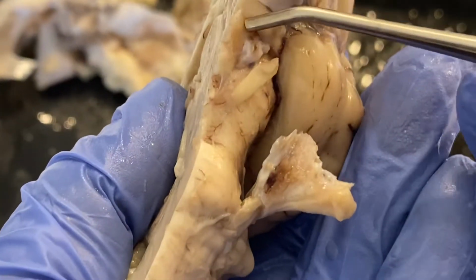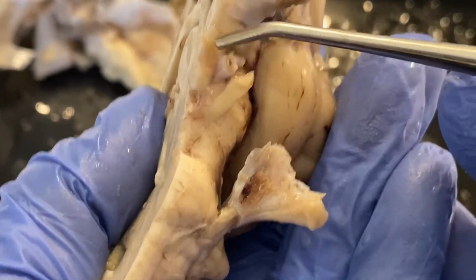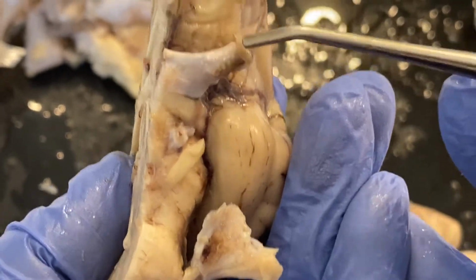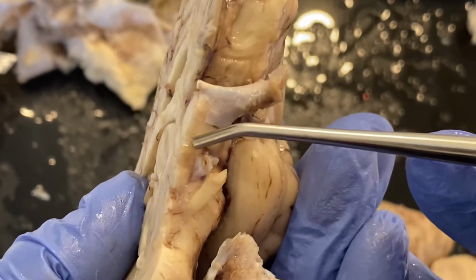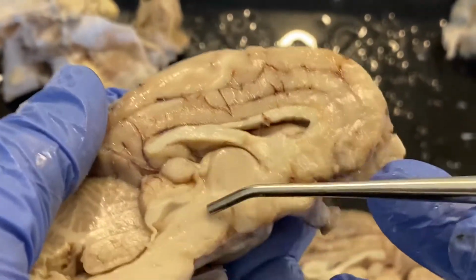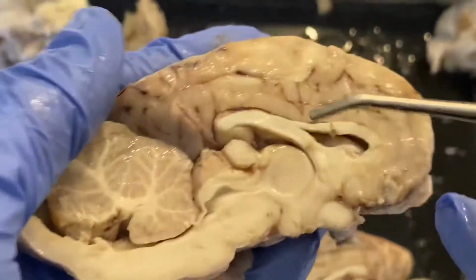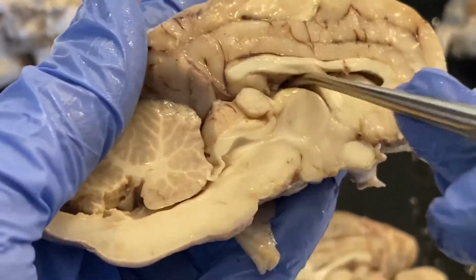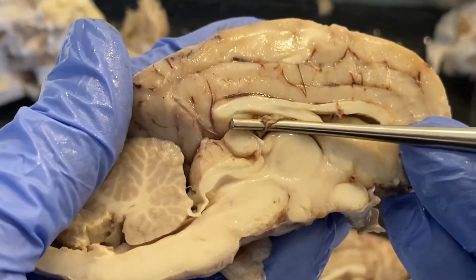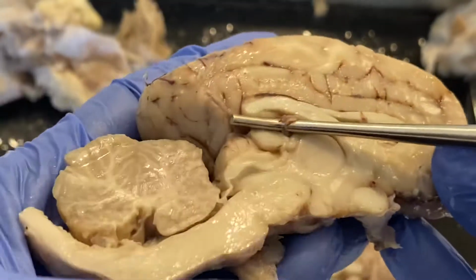We have the infundibulum, mammillary body. And up here, superior, is that optic chiasm, right? The optic nerve as it comes down. Okay, so that represents our diencephalon, this area here. Now again, this is surrounded by the third ventricle, and so there is choroid plexus inside this third ventricle as well.